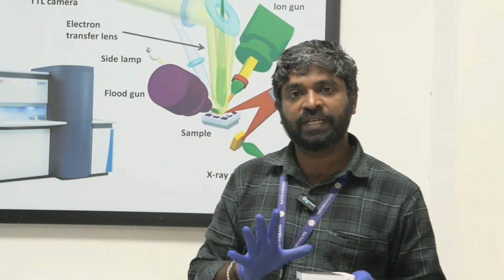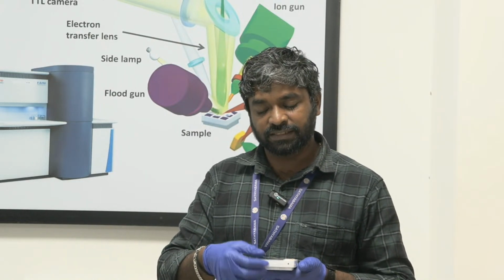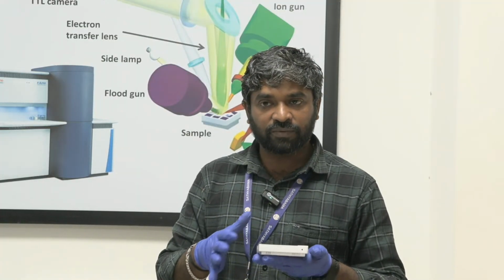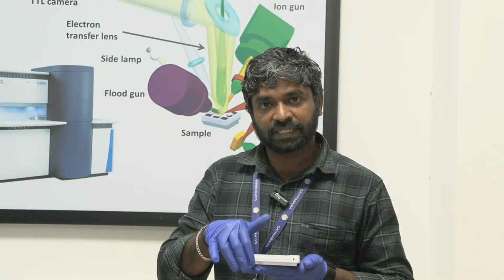You can remove the layer by layer, then you can perform XPS. But you have to be very careful in selecting the ionization energy. If you give more ionization energy, it will damage your samples, so you have to give the very minimum energy to remove the sample surface. But this is not applicable for bulk powder samples. If your samples are thin film or bulk samples, you can do etching, and you can do any depth profile analysis in order to study the depth information of your materials.